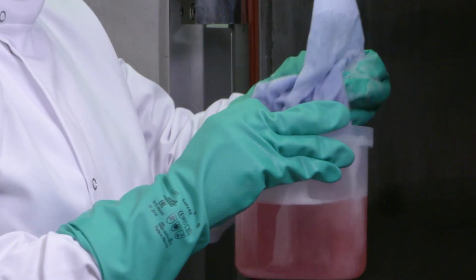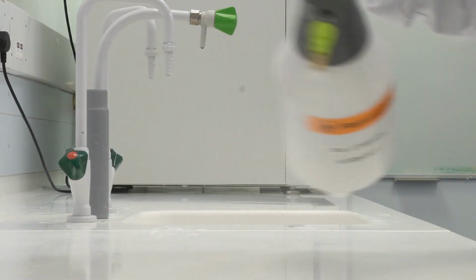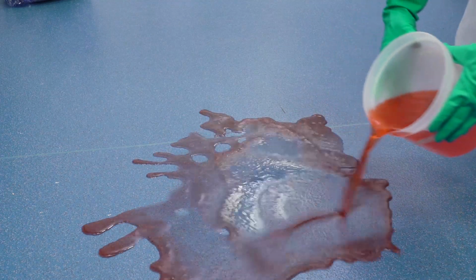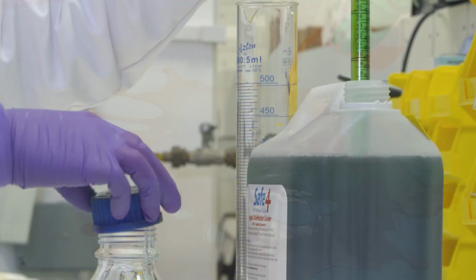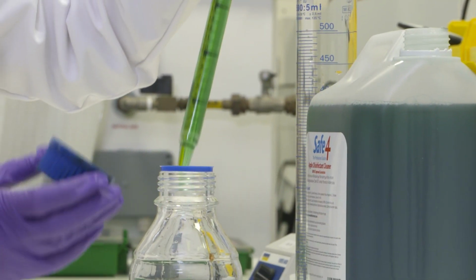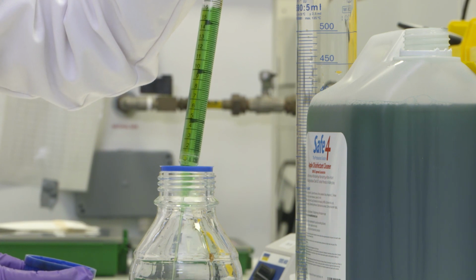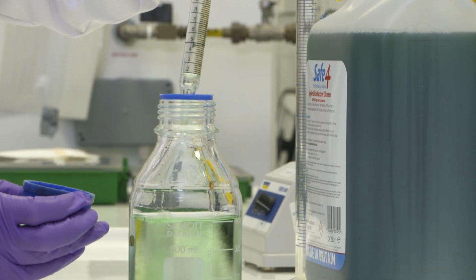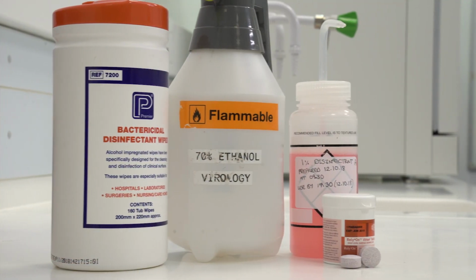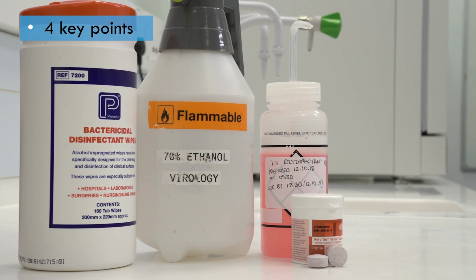The choice of disinfectant, its concentration and contact time will all vary depending on the biological agents you are handling. Surface decontamination is usually carried out using liquid disinfectant solutions. Every time you use disinfectants, it's very important that you are confident that you are meeting the following 4 criteria.